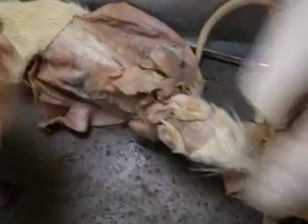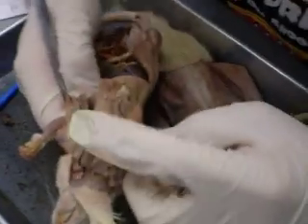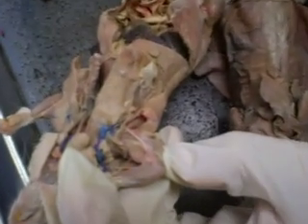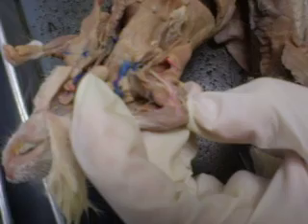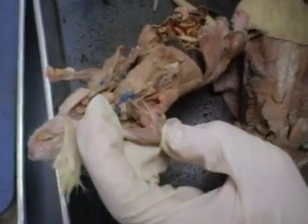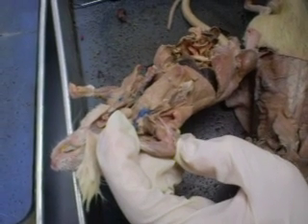And then you'll need to know your biceps complex. Okay.